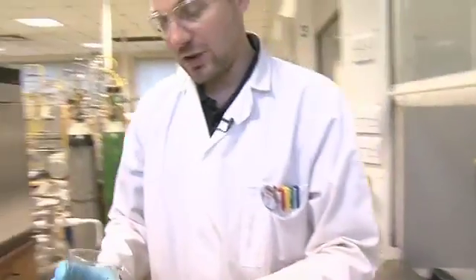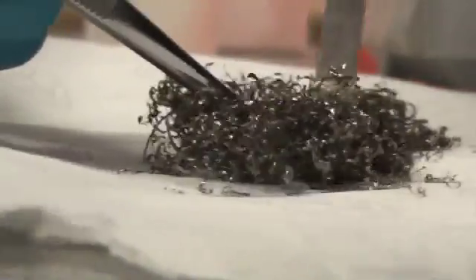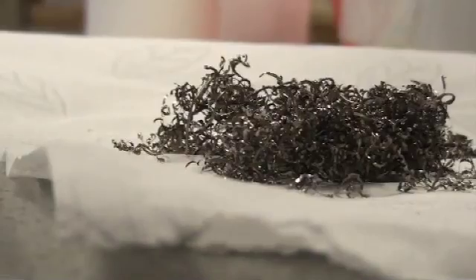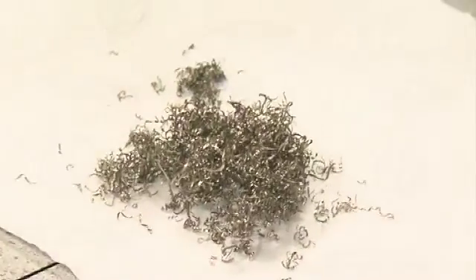And then we're going to tip this out and pat them dry. There you go — some naked uranium. To the eye that would look like just any other metal, and to all intents and purposes, because the radioactive component is gone, that's all it is. It's just another metal in the periodic table. Only it's the boogeyman.